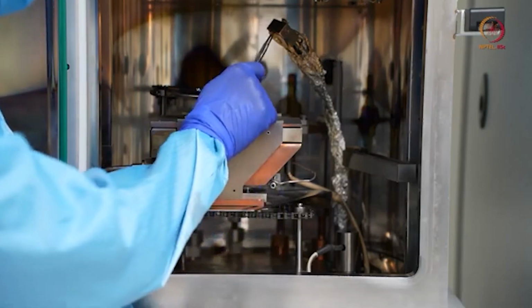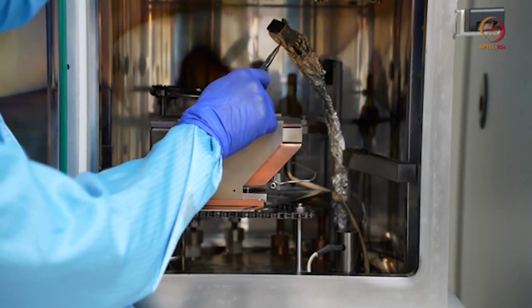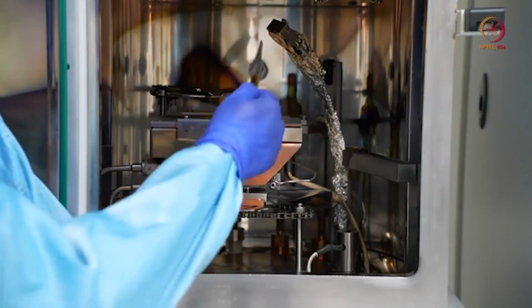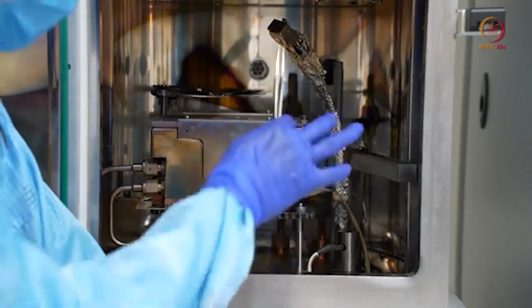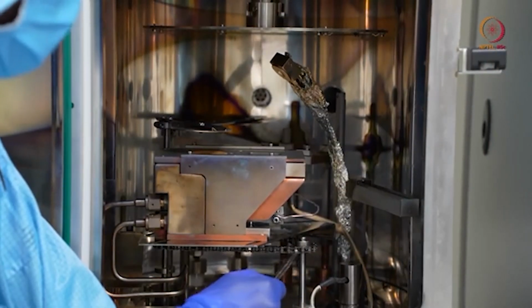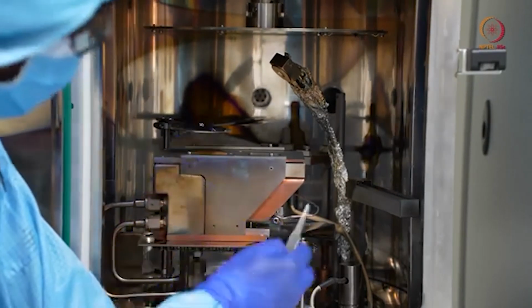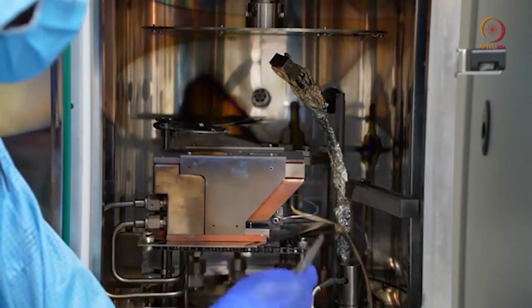Here you can see this is a QCM, or quartz crystal monitor. It will be deposited at the front side, and the data we can get from the DTM that we have already shown and discussed. And here you can see one turret. This is for movement of the turret or the crucibles. The crucible we will take out and show before that. So this will be useful for moving the things.